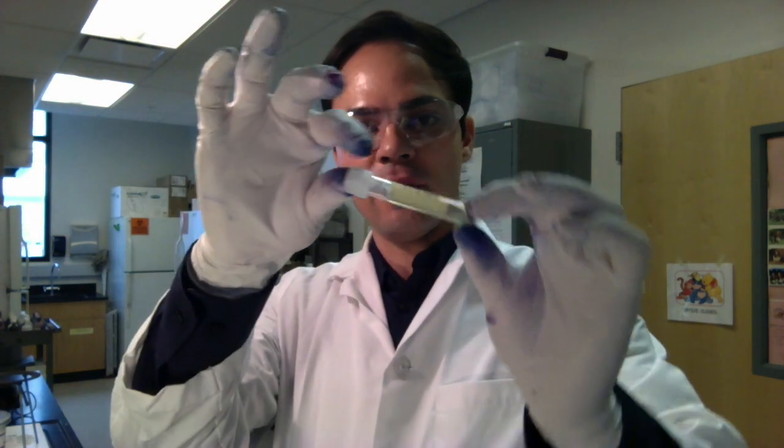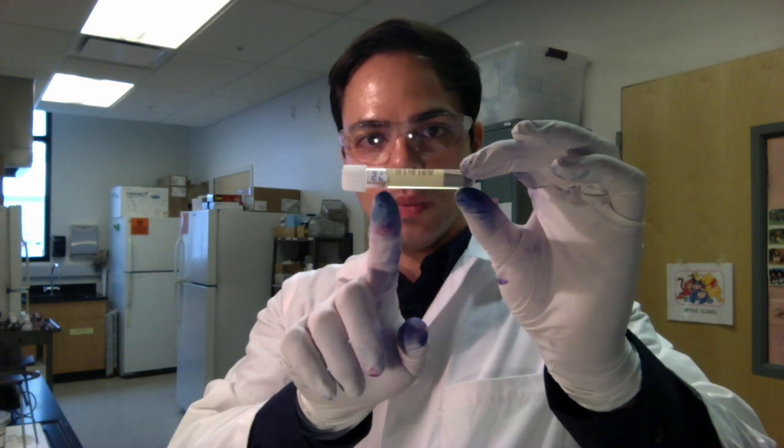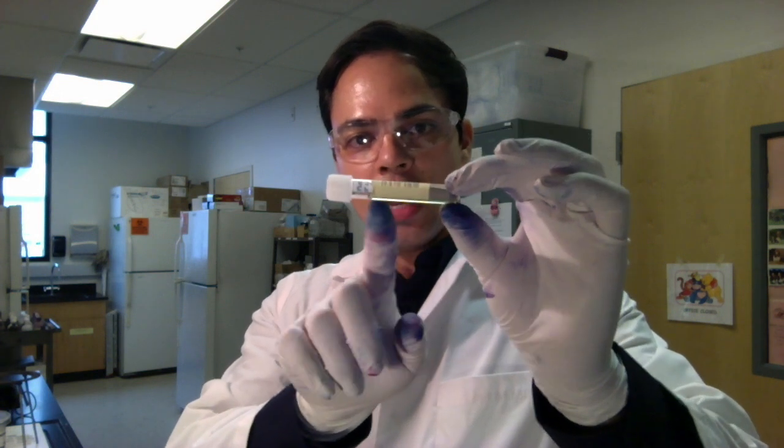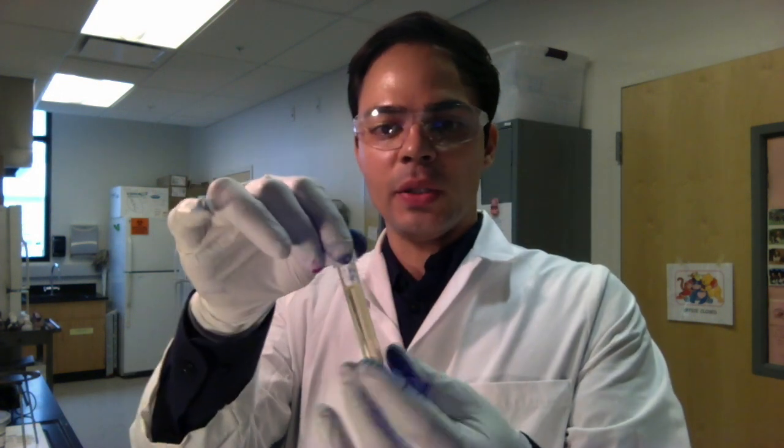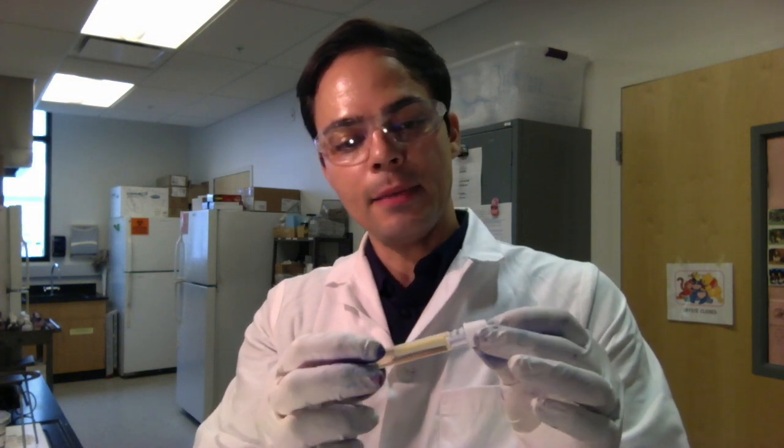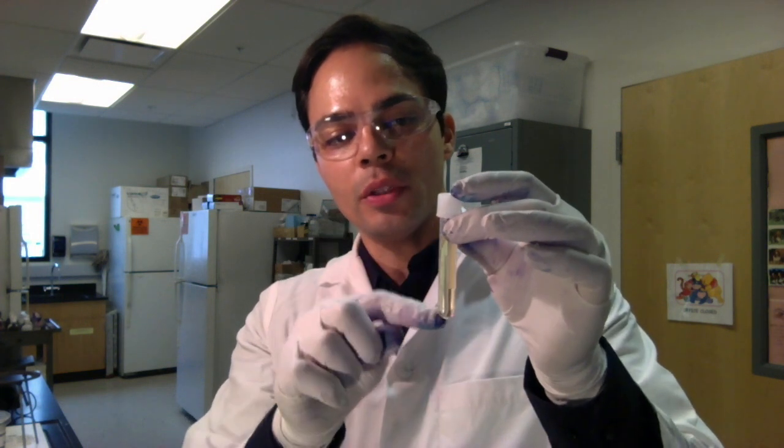This is SIM media. Notice that if I turn it to the side, the medium actually is solid in there. That's because there is agar in this medium. The SIM stands for sulfur, indole, and motility which are three things we will be testing for. So we will stab this one straight down and up along the same line.